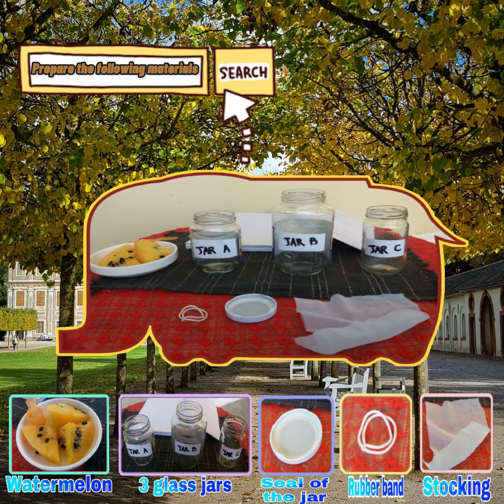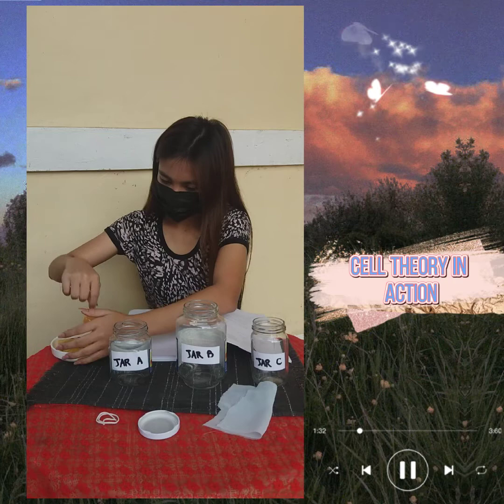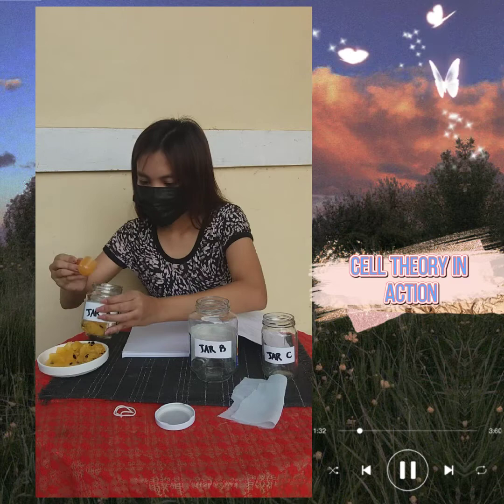After preparing the following materials, you can now proceed to the activity. First, mash the fruit. After mashing the fruit, put a piece of fresh fruit at the bottom of 3 jars. In jar A, keep the jar open.